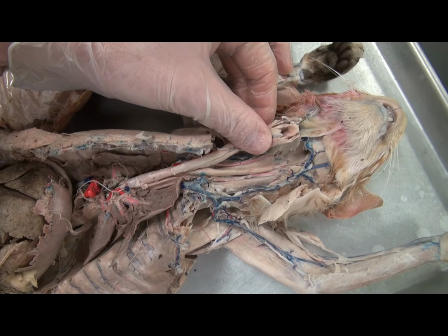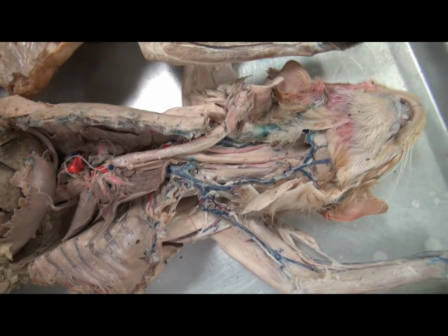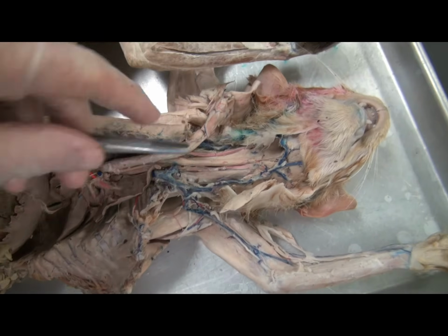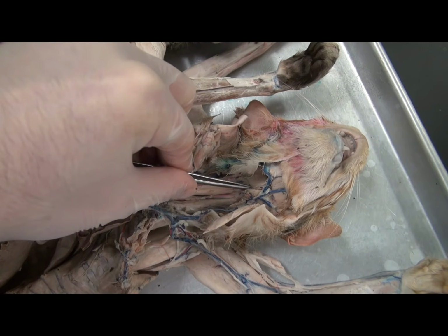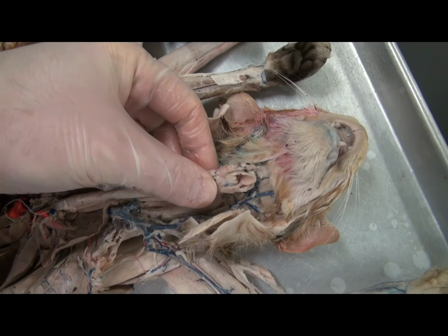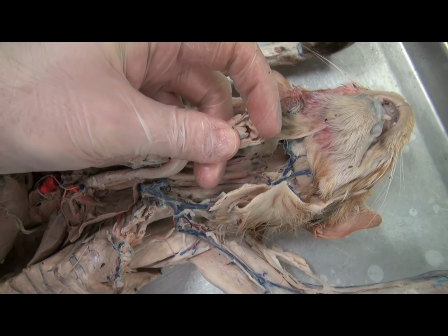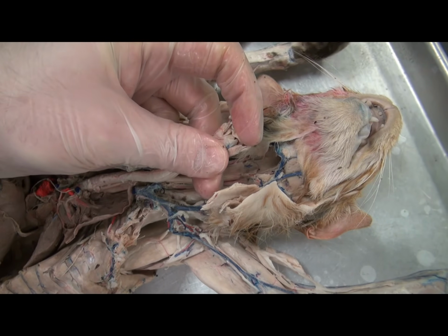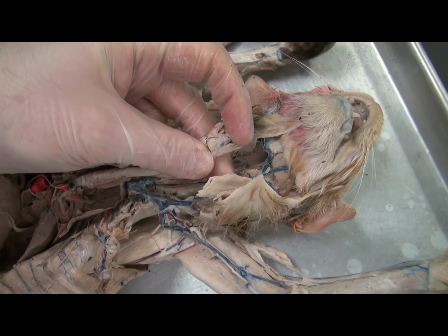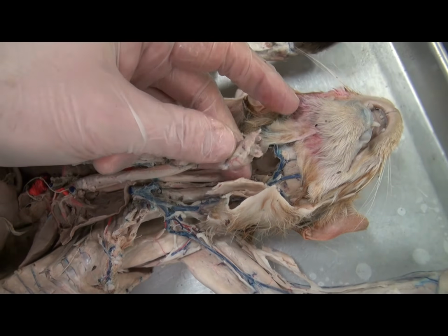On this dissection of the cat, one can trace the structures of the digestive system. Once food is swallowed, food passes from the oropharynx to the laryngopharynx. Now, since food and air share this pathway, note that the larynx has an elastic piece of cartilage, the epiglottis, which closes over the opening to the larynx, the glottis, so that a bolus of food cannot enter the airway.